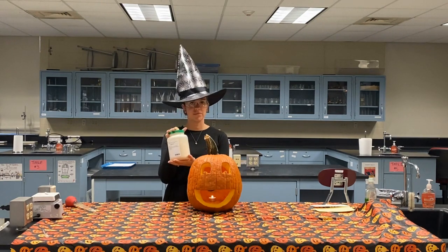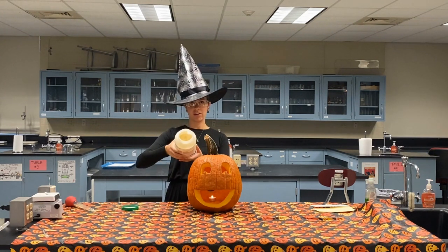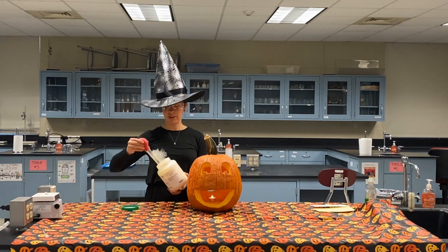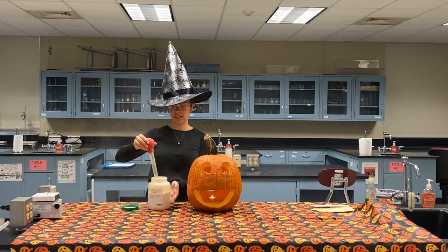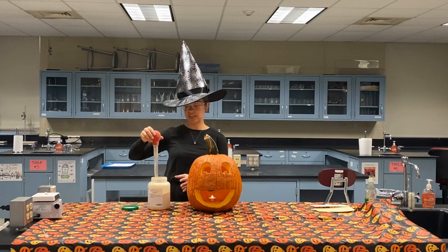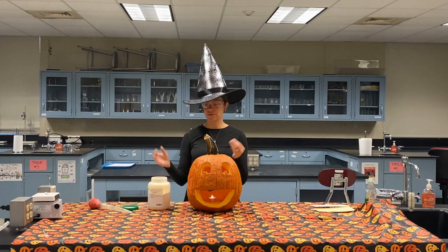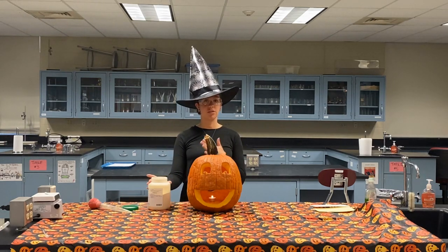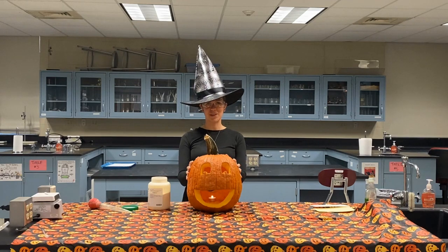Now, what I'm going to be using is something called lycopodium powder. And lycopodium powder is a very fine yellow powder. Maybe a little tricky to see, but you can see there a little bit more what it looks like. Now, what is lycopodium powder? Lycopodium powder is basically a moss spore. So it's a very, very fine powder. Now, is this flammable on its own? No, it is not typically flammable on its own, but I'll explain why we see this happen in just a moment. So, my able-bodied assistant, Mr. Roberts, is going to shut the lights off momentarily here, and we'll get started with our fire-breathing pumpkin.